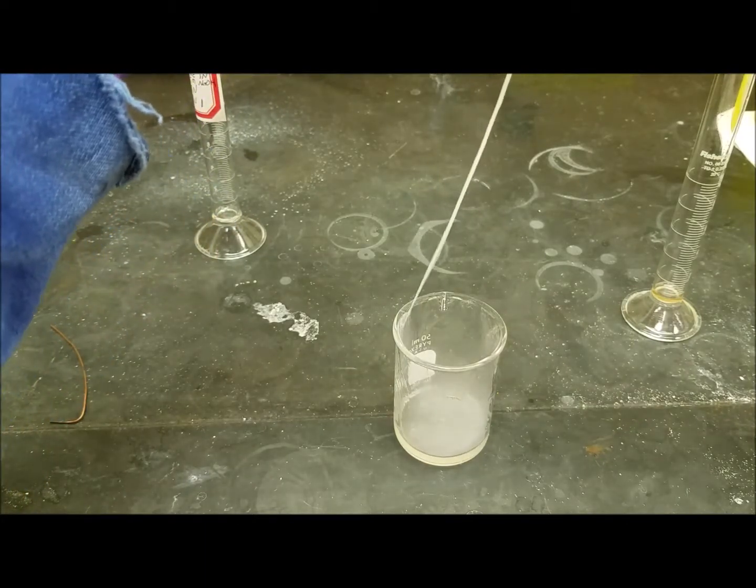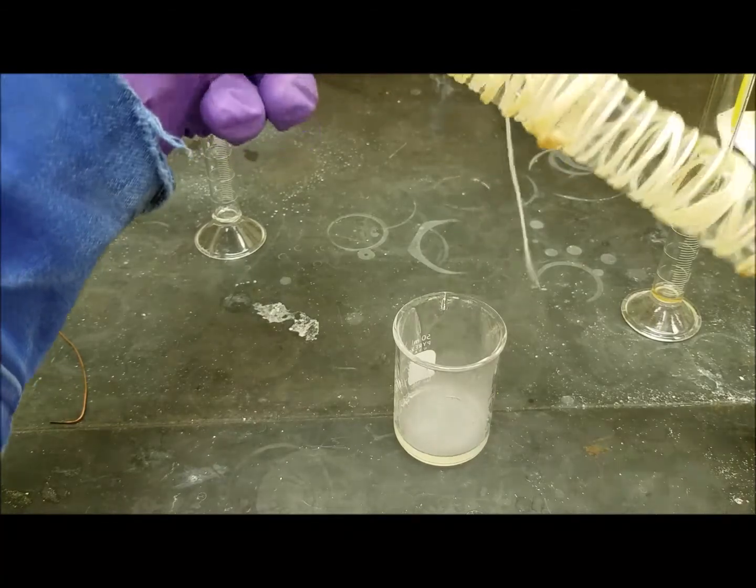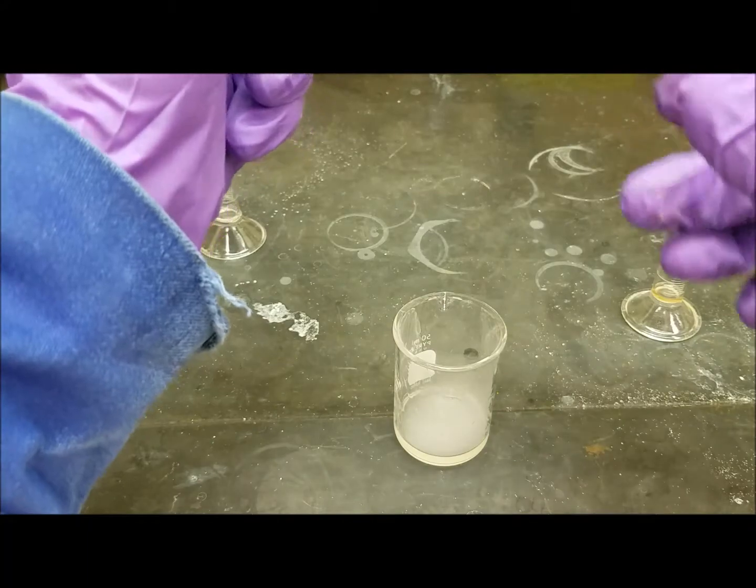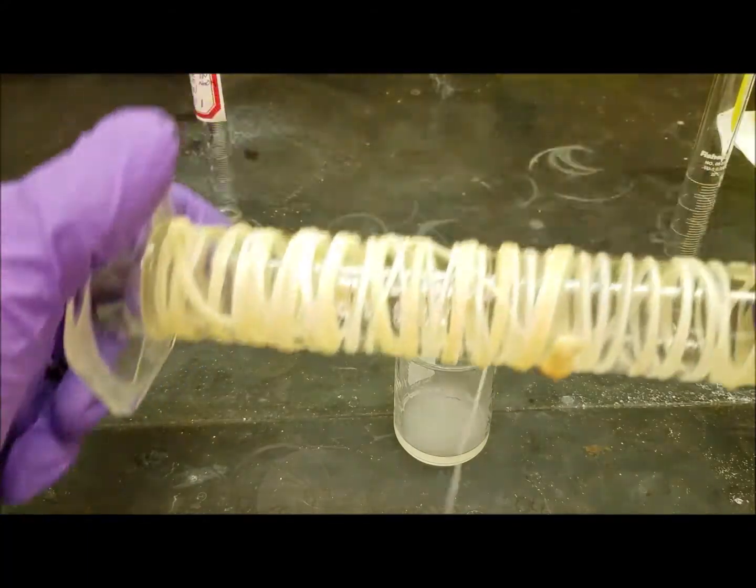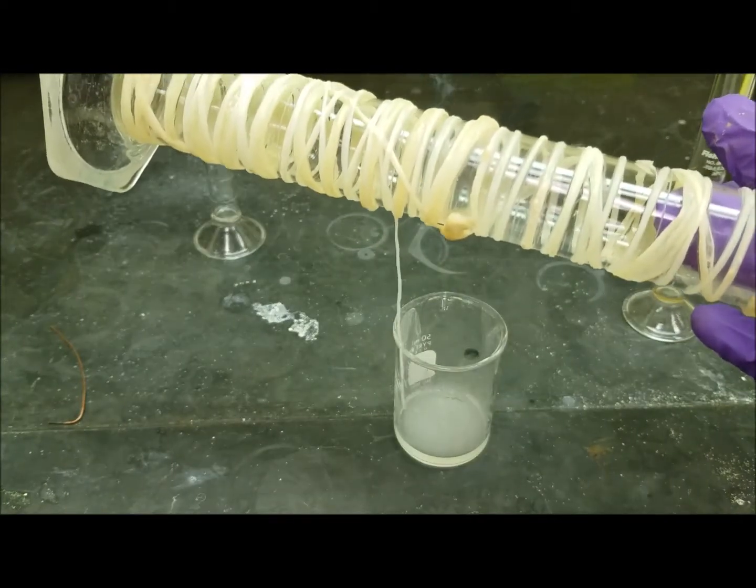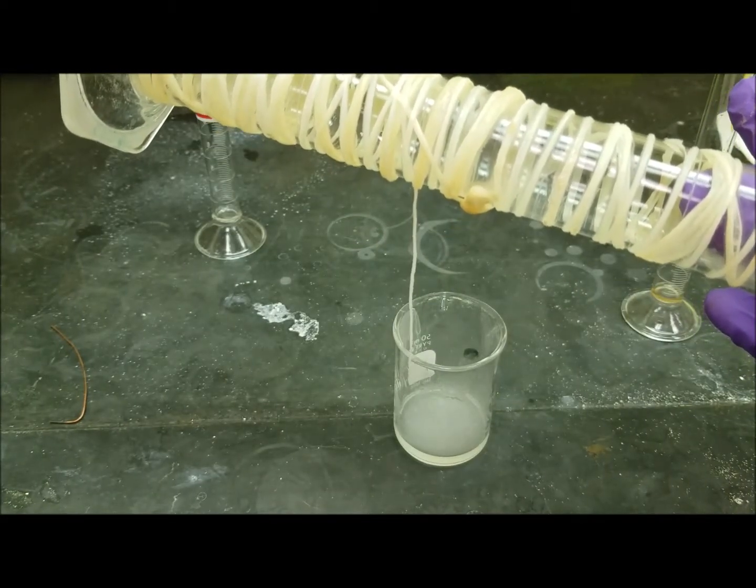It's got to be almost done. There we go. We've come to the end of the nylon. All right. So here we go. All that from those two liquids through interfacial polymerization.